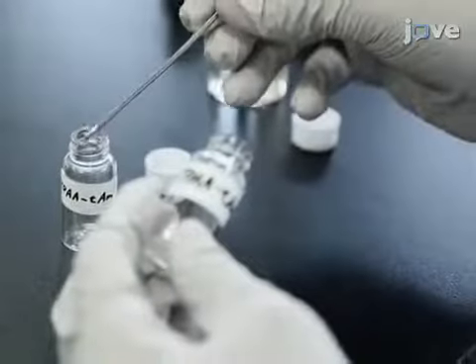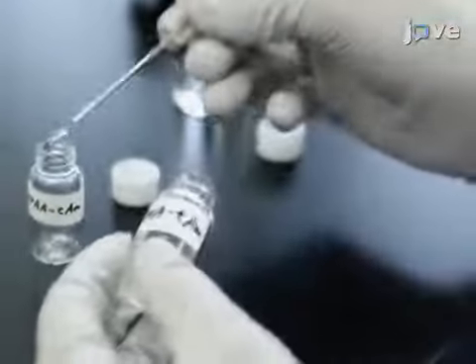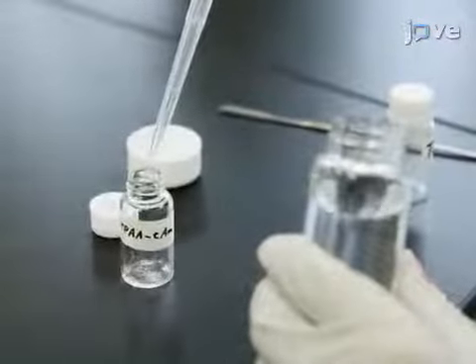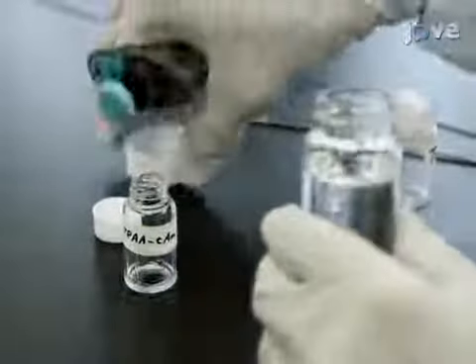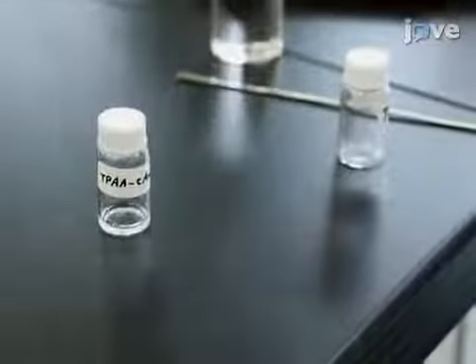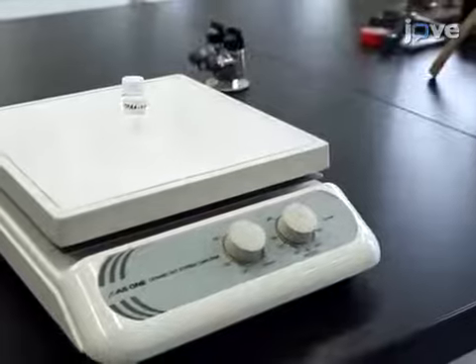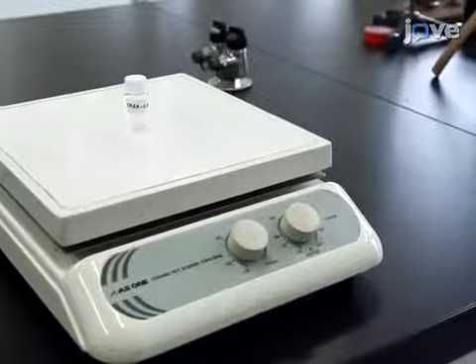To prepare single crystals composed of supramolecular clusters, dissolve 5.0 milligrams of each of the organic salts in a glass vial in 0.30 milliliters of toluene as a nonpolar good solvent. Toluene was selected because the supramolecular clusters are preferably constructed in a nonpolar environment. For the organic salts, heat toluene up to 40 degrees Celsius to dissolve them.